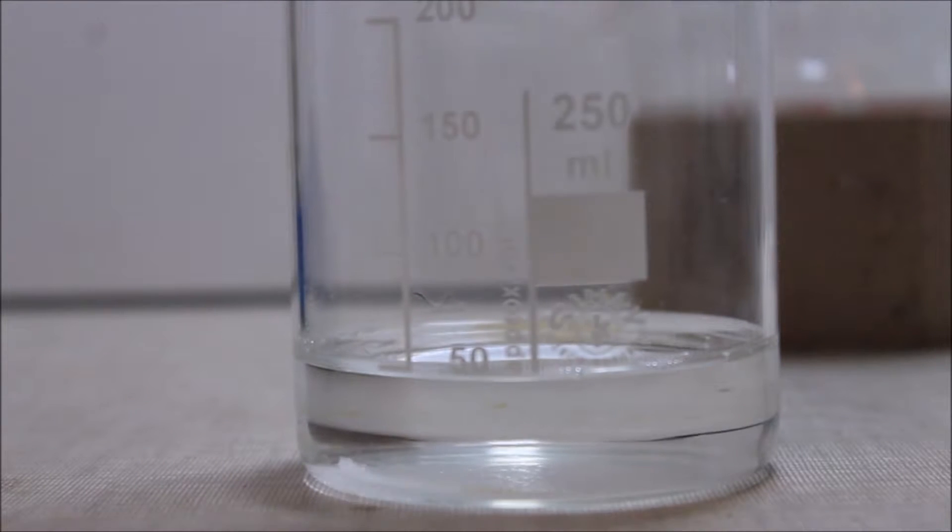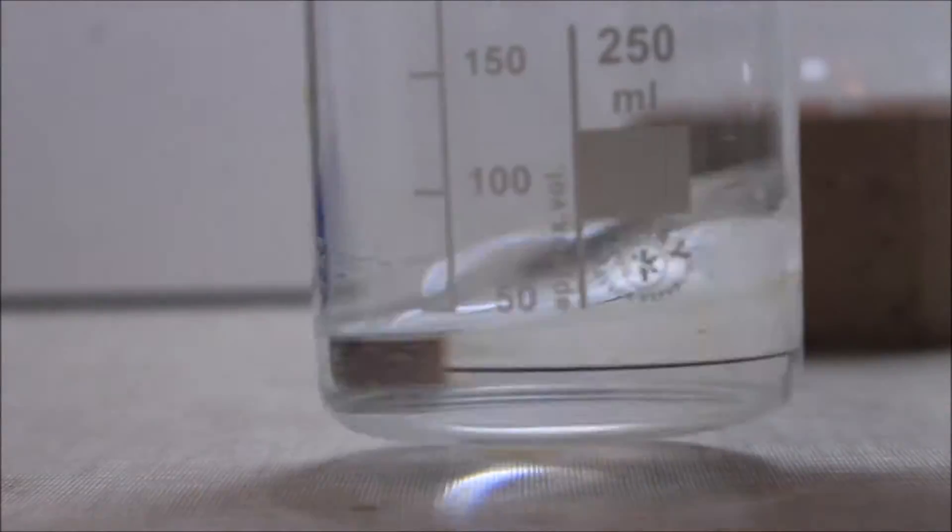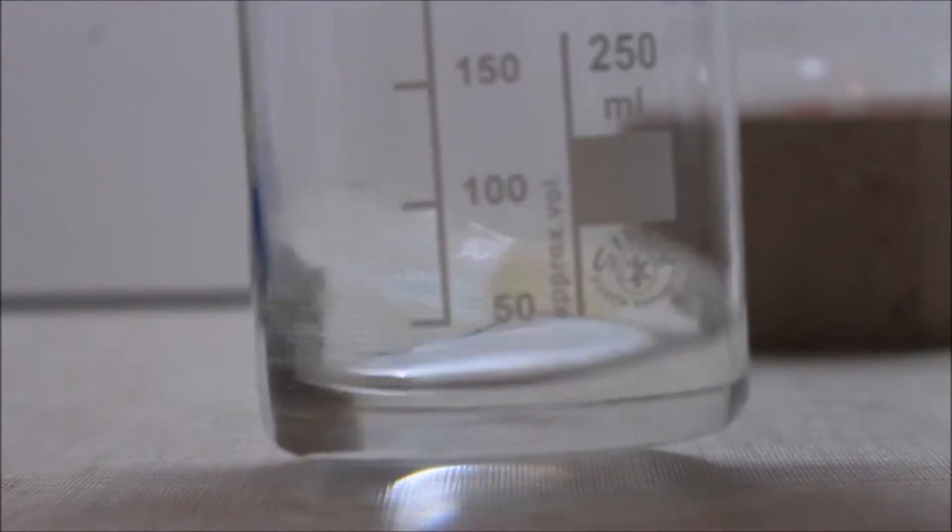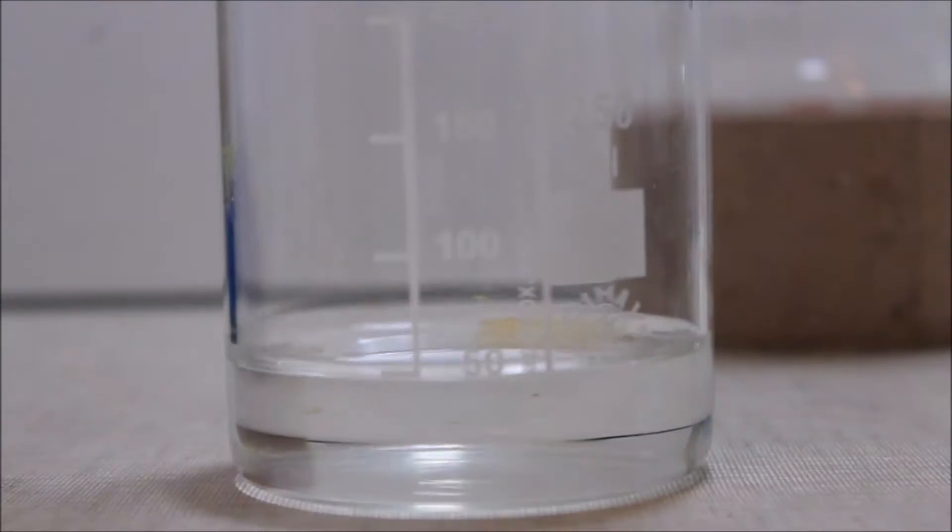Then 0.85 grams of pure silver nitrate are dissolved in 50 milliliters of distilled water. It is important that the silver nitrate is relatively pure, if not the reaction might not work as good as expected.